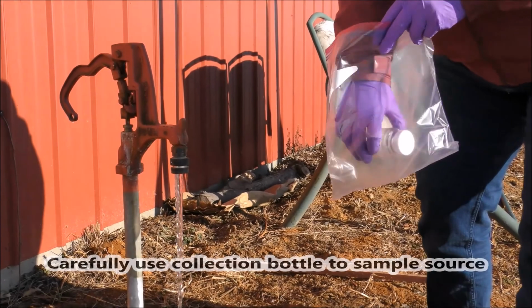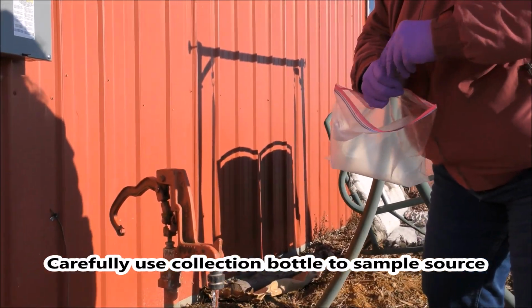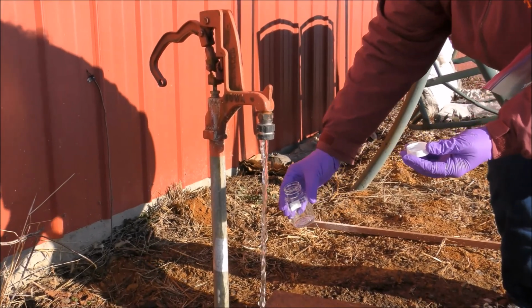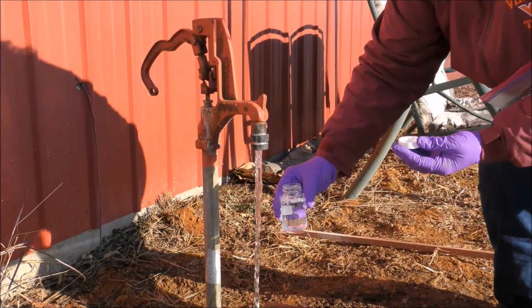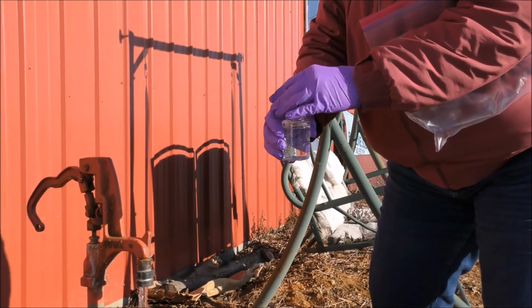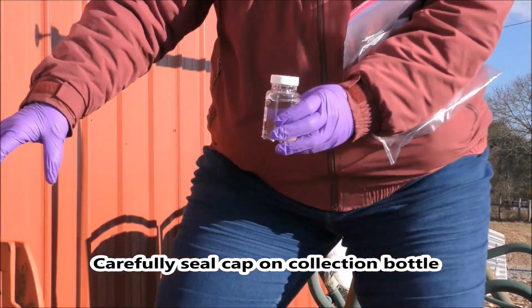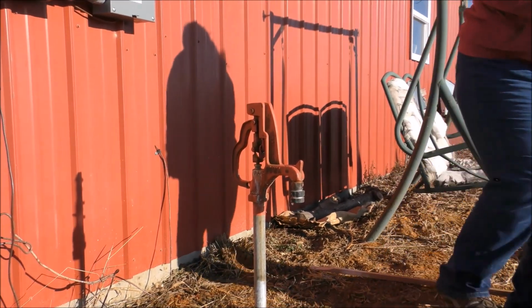Take the collection bottle out of the sampling kit, envelope, or Ziploc bag. Open the bottle, avoiding touching the inside of the bottle or cap, and carefully place the cap in a sanitary place, such as inside the Ziploc bag. Do not place the cap on the ground. Place the collection bottle under the spigot to collect water, being careful to avoid accidentally touching the spigot with the bottle. When the collection bottle is full to the shoulder or the fill line, seal the container by carefully replacing the cap and tightening. As mentioned previously, do not touch the inside or lip of the collection bottle.